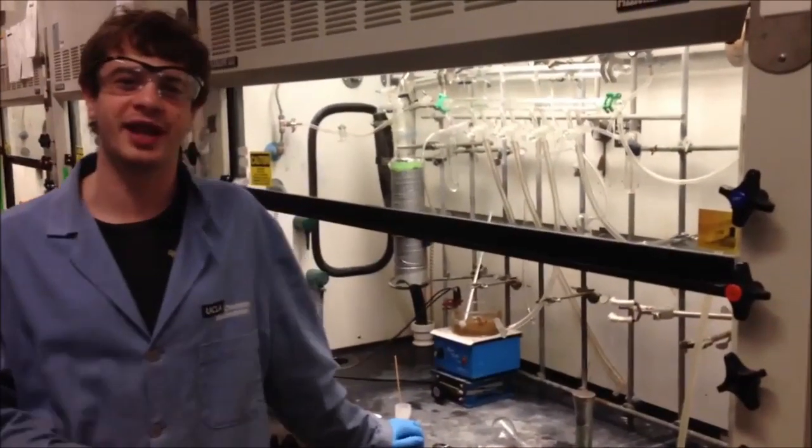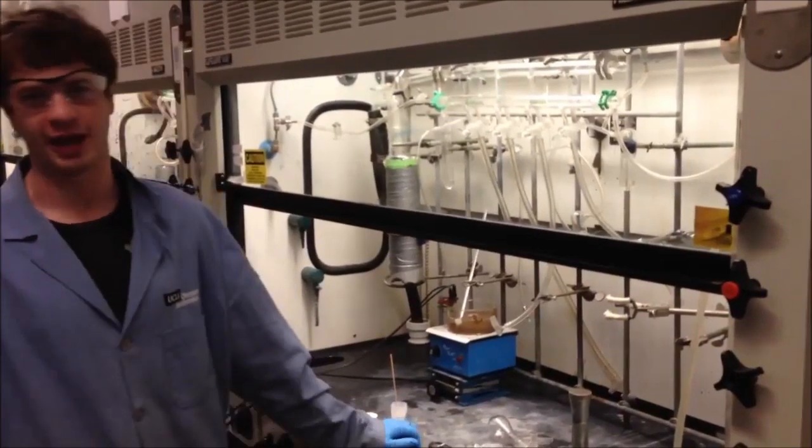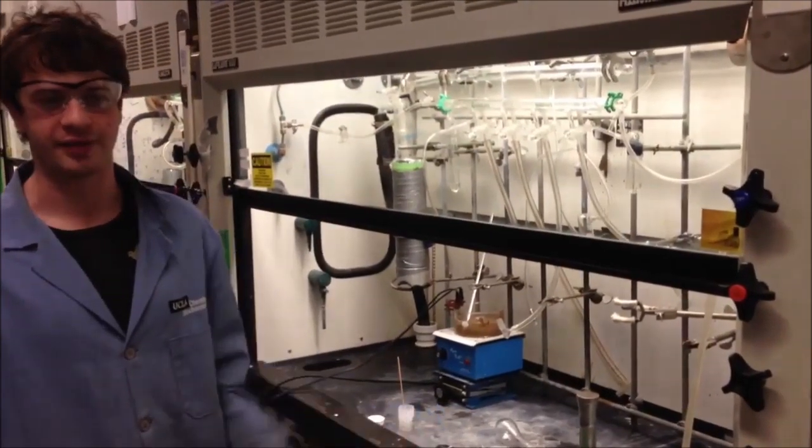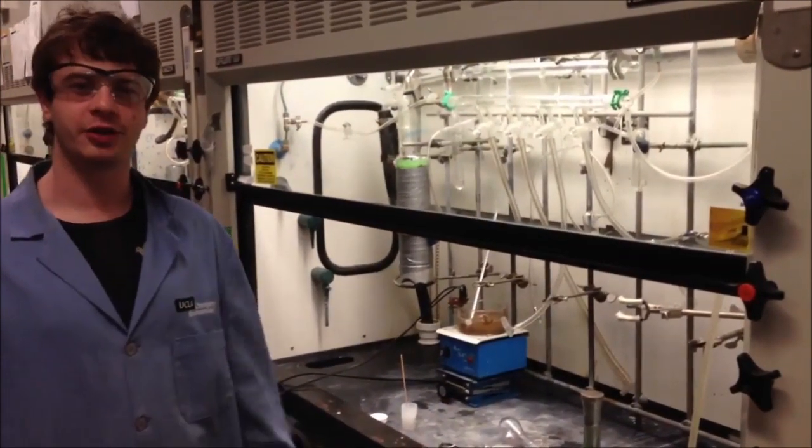Hello, okay, so today I'm going to give you a taste of what we do here in the lab. And in that vein, we're going to be synthesizing a reagent known as DMC.